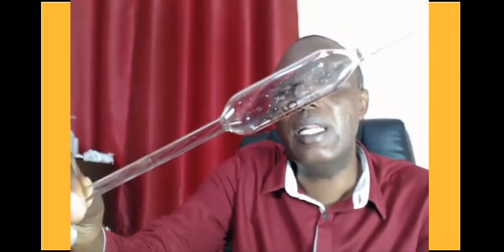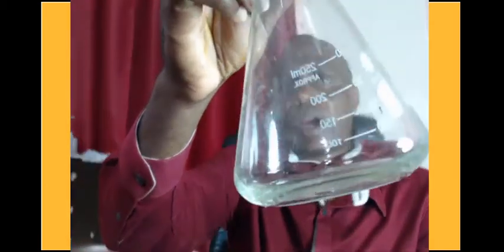We also have a 25 milliliter pipette. In this experiment, we are going to fix the solution of iron(II). We will put it in the conical flask. So here I have the conical flask where I will put my iron(II) solution, and then from there we are going to start the experiment. The objective of this experiment is to determine the mole ratio that exists in the reaction between iron(II) and dichromate(VI).